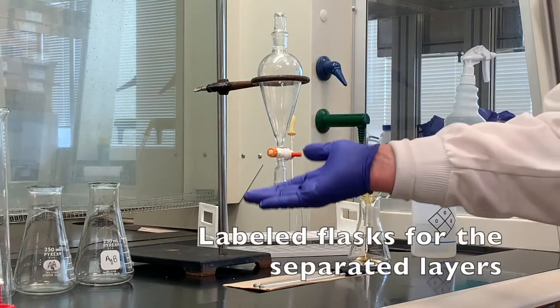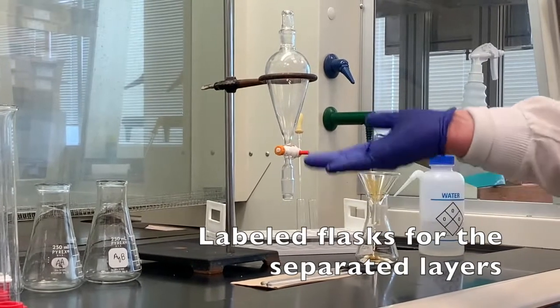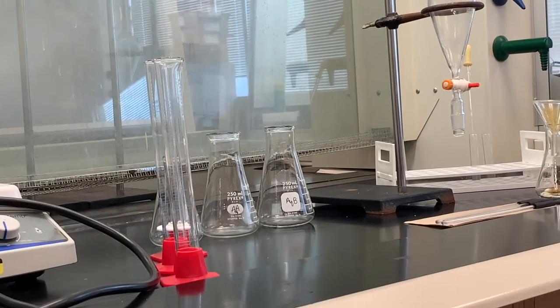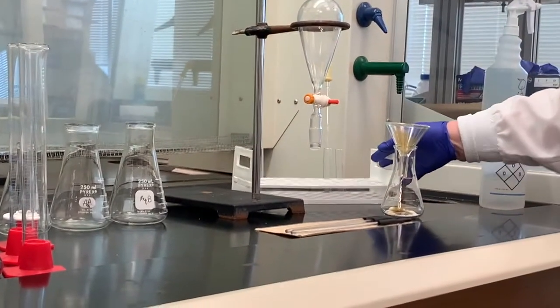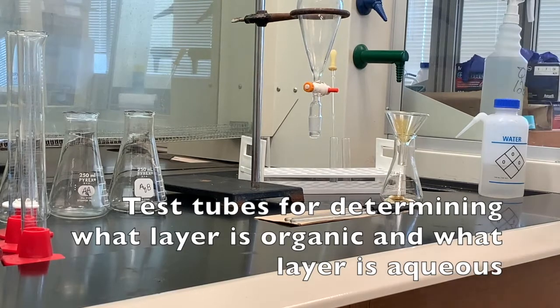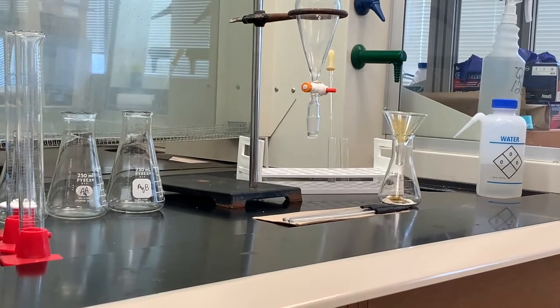We will need a few flasks to collect the aqueous base, the aqueous acid, and also the neutral layer. We need graduated cylinders to measure out the aqueous acid, the aqueous base, and the dichloromethane. When we do the extraction, we need to make sure which layer is which. And if you have trouble with that, I've got some test tubes and a pipette. There's another type of test tube test that we can take a look at in terms of how to distinguish one layer from another when you're doing extractions.